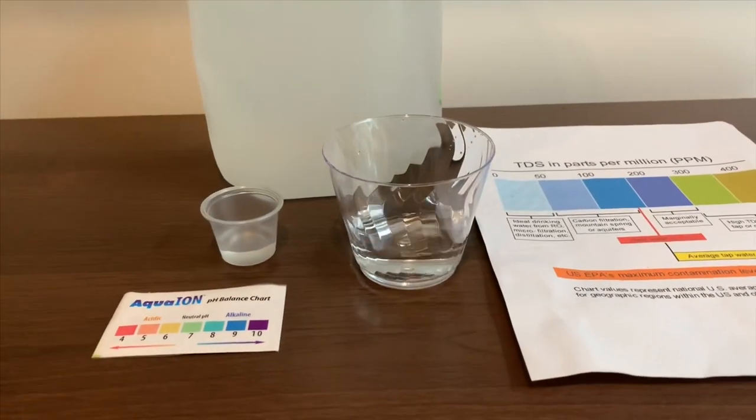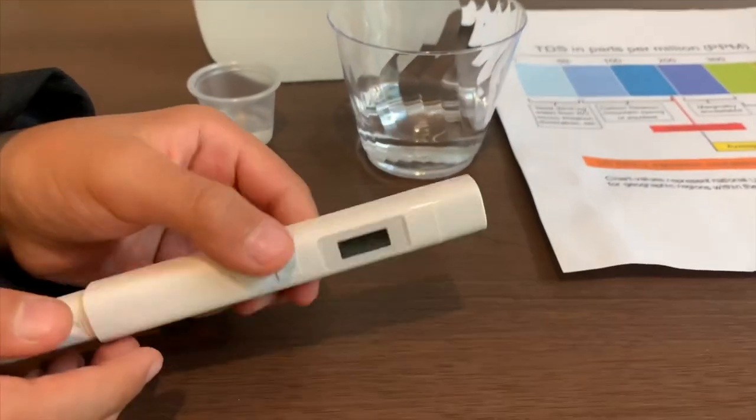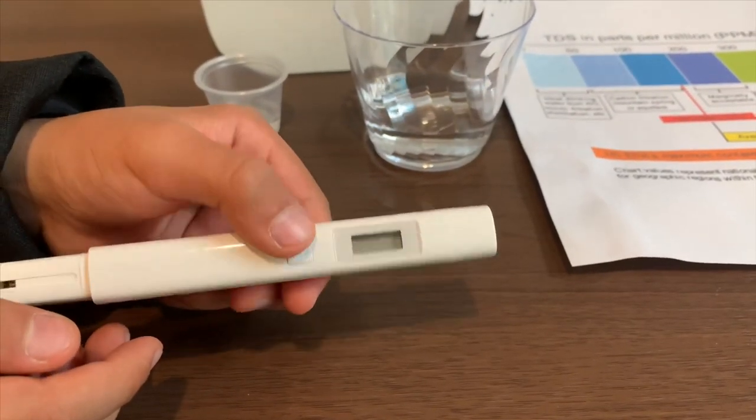First, let's test the TDS level. If you want to buy this TDS tester, check the link down below.